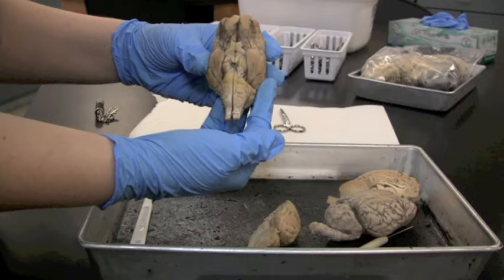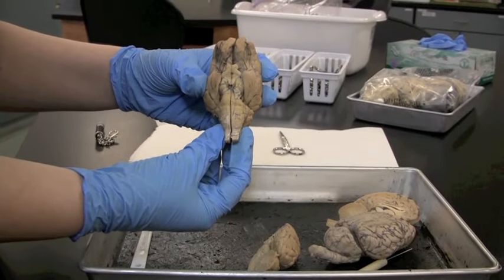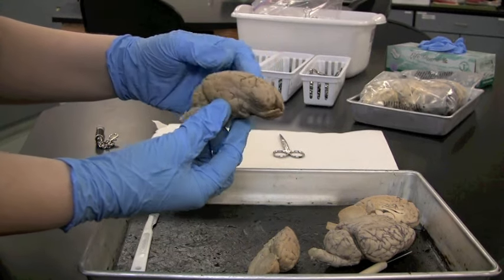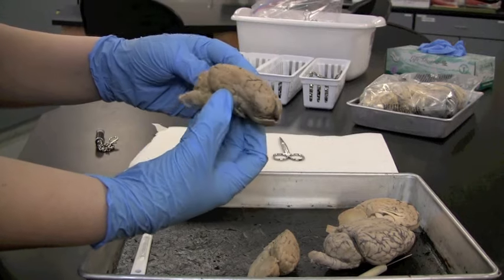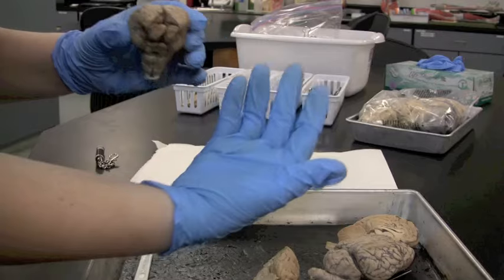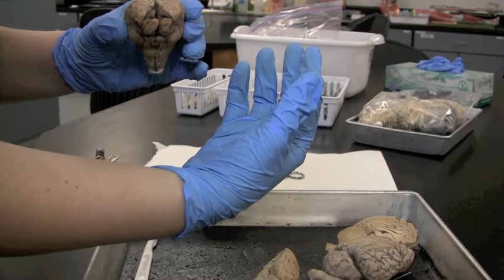That is a pretty good overview of our sheep brain. Goodbye from lefty. Goodbye from righty. We're on to the eyeball next.